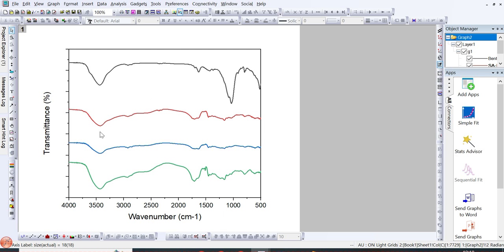Okay, the next step is to mention or label the name of each spectrum. For example, this line is for activated charcoal, so we can write the name of this line here. From here, click on the text tool, and after that you can drag your cursor here, click on this, and write activated charcoal. Then you can press Control A to select this writing, bold it, and increase or decrease its size as this one, and then you can simply place it here.